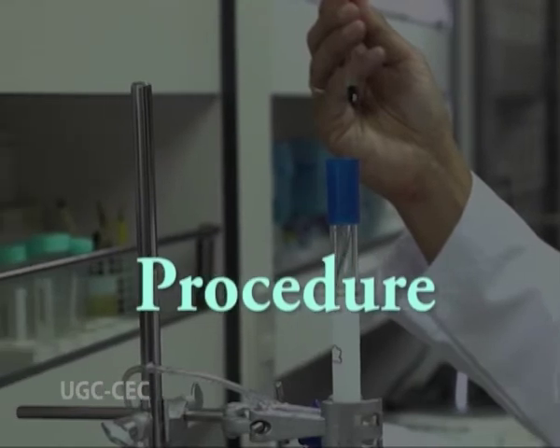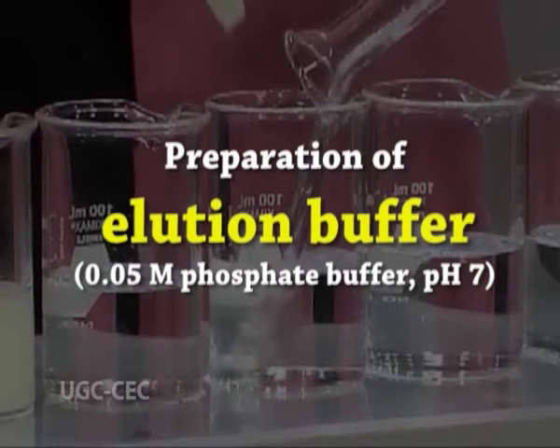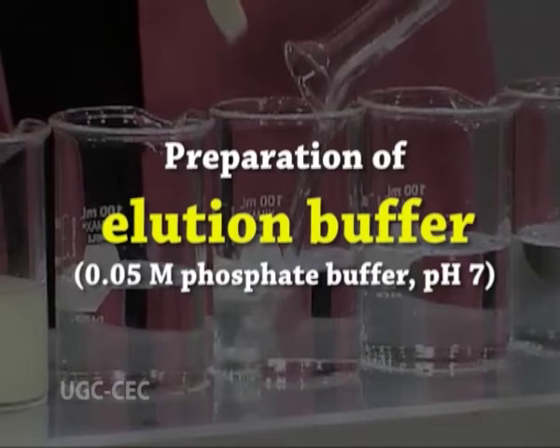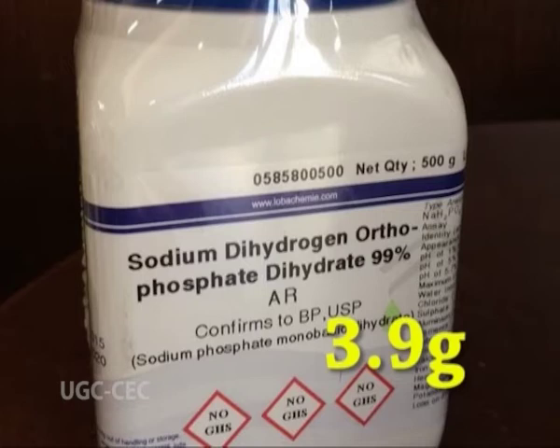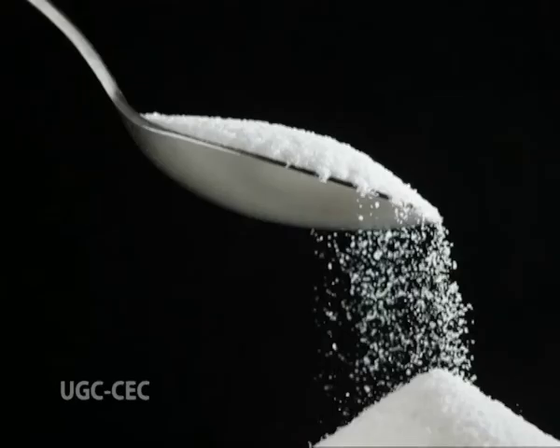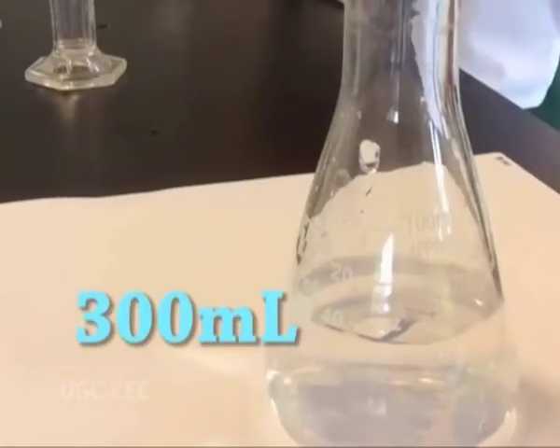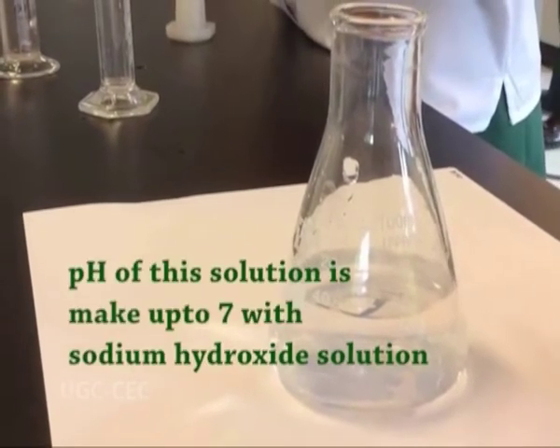Now let us come to procedure. First is preparation of elution buffer, that is 0.05 molar phosphate buffer at pH 7. 3.9 g of sodium dihydrogen orthophosphate dihydrate and 4.5 g of sodium chloride is dissolved in 300 ml of distilled water. The pH of this solution is adjusted to 7 with sodium hydroxide solution. After this, the volume of the solution is made up to 500 ml with distilled water.